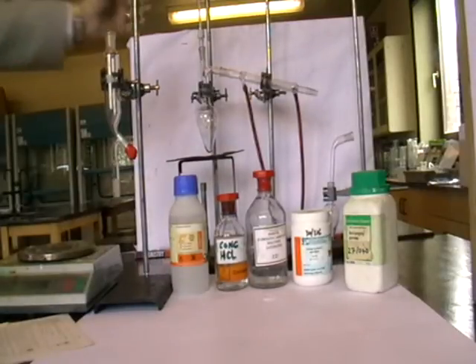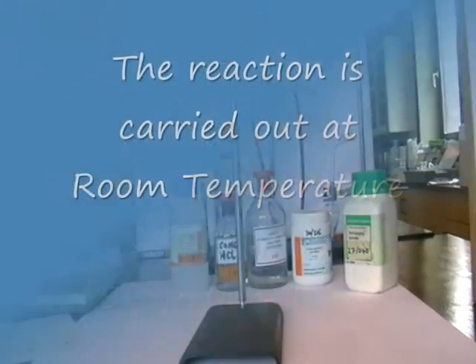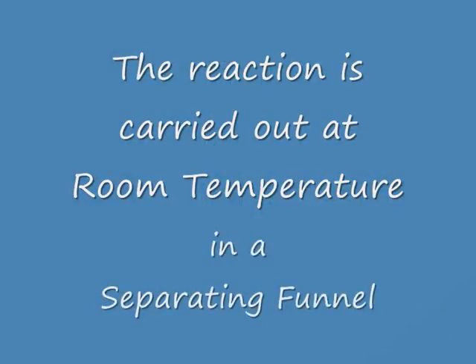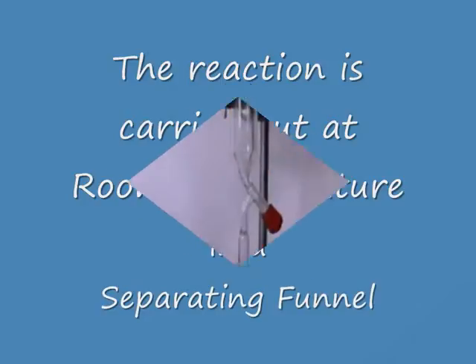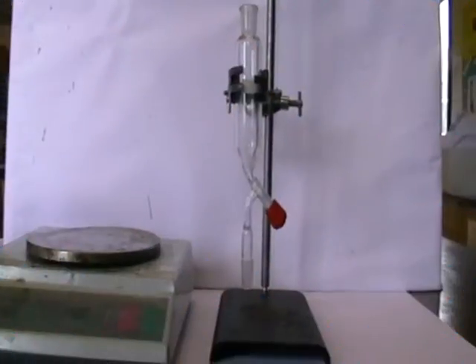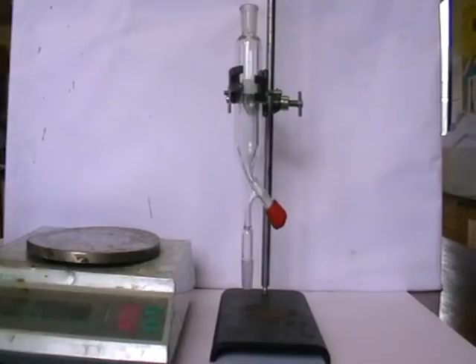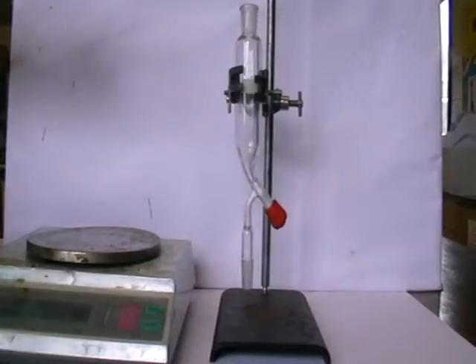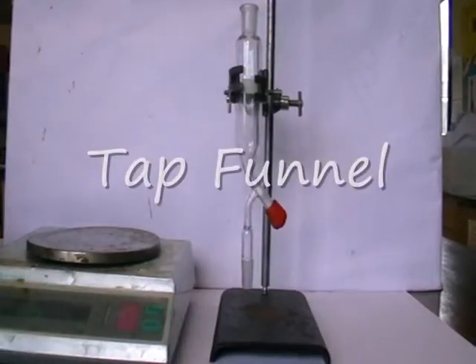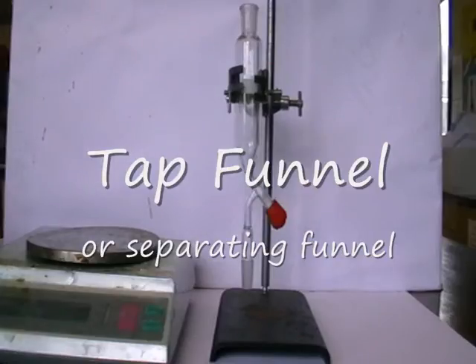The reaction is carried out in a separating funnel. We're ready now to carry out the reaction itself, and it will be carried out in the tap funnel, or separating funnel, you see on the right.